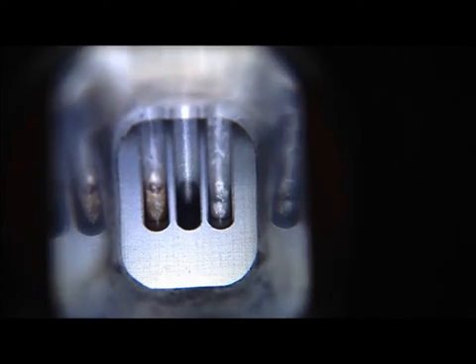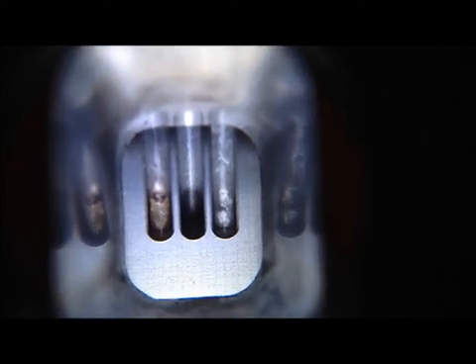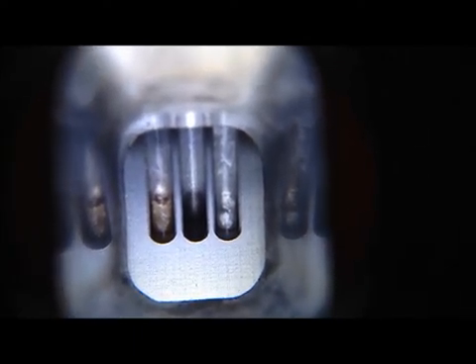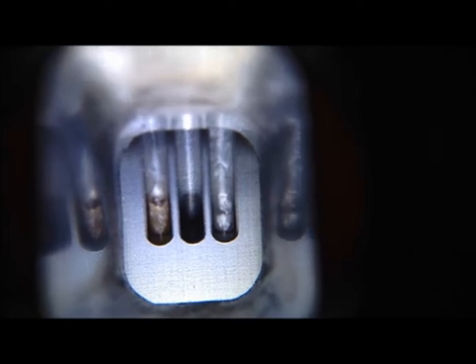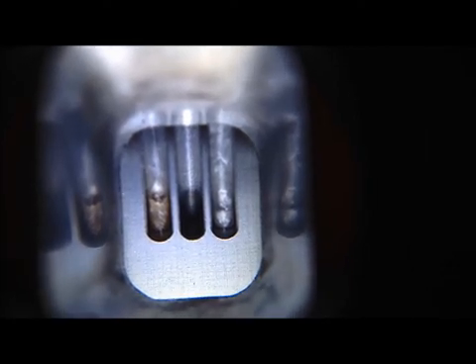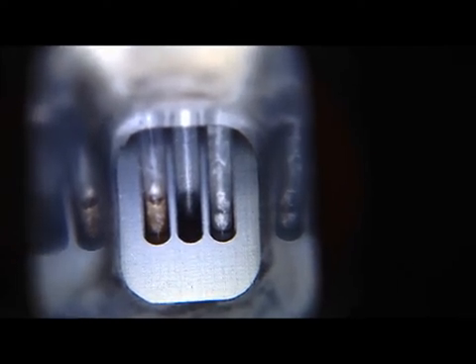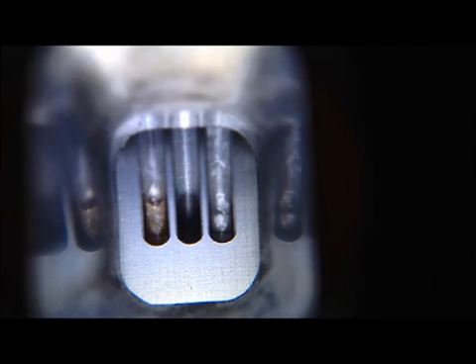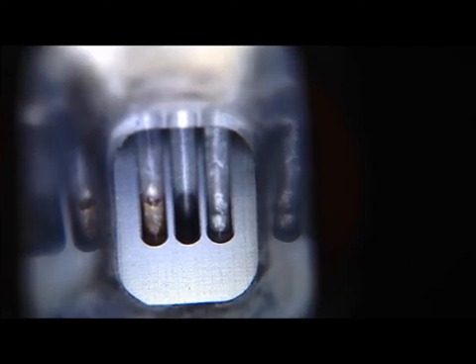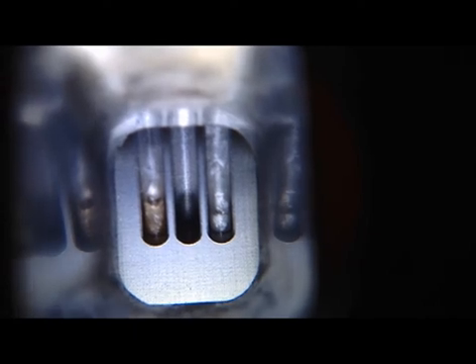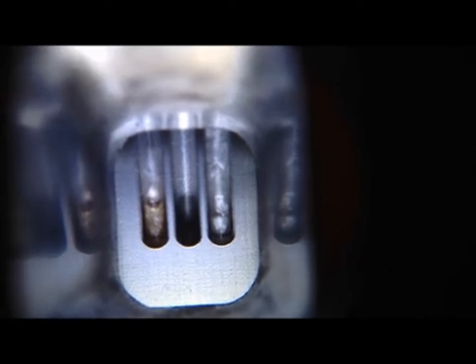Let me zoom in here and see how good my iPhone can do. What we're looking for is the temperature at which the solid first begins to melt. A melting point is a range, it's never really just a number unless your sample is super pure. So we're going to look at these crystals and see the temperature at which it first starts to melt or it first starts to change in appearance. And this is going to take a couple of minutes here.